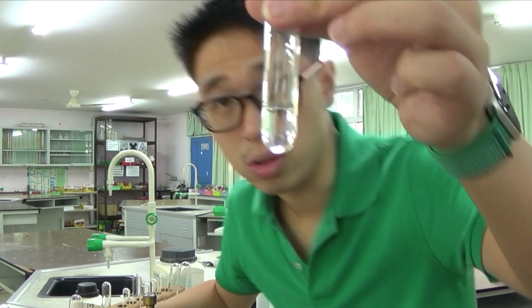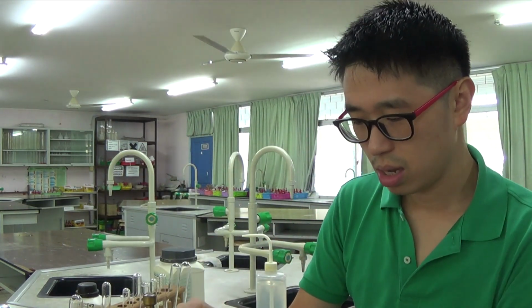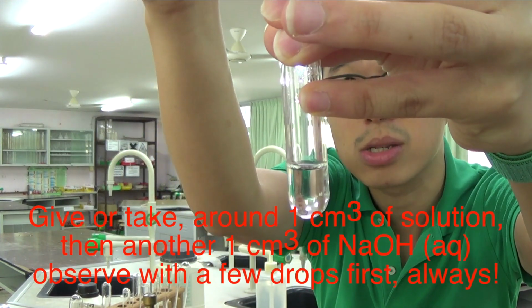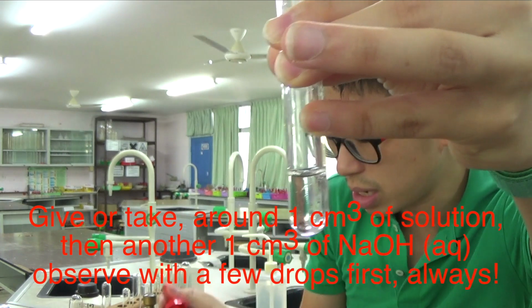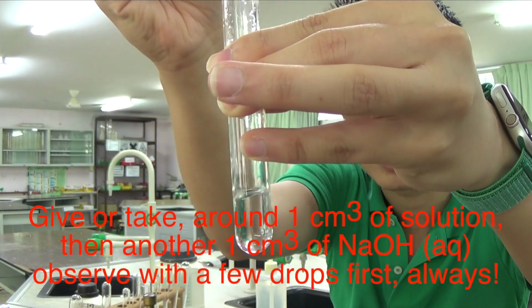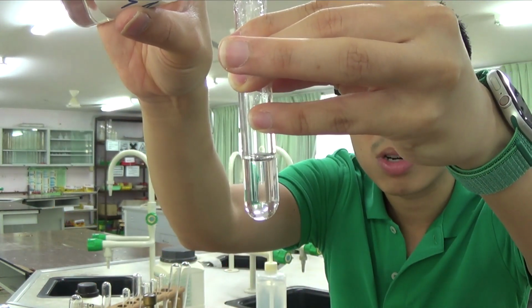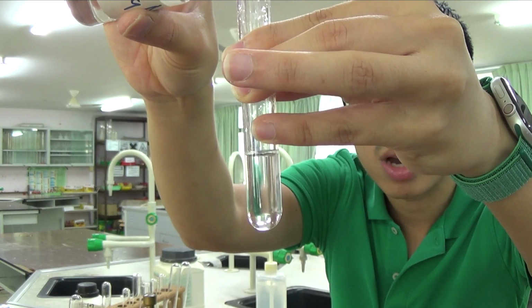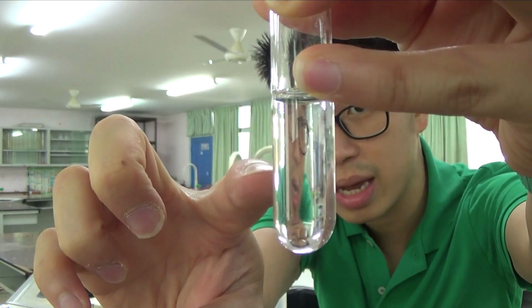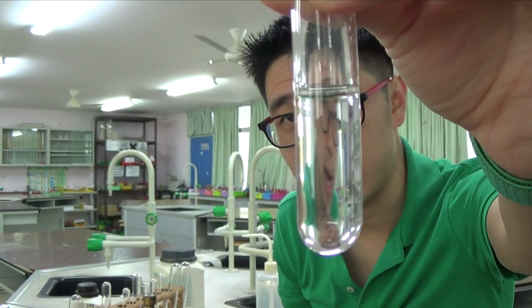So this was the solution, ammonium carbonate. So I'm testing for the cations. So when I have that much solution, I should add that much sodium hydroxide. So it's usually an equal amount of sodium hydroxide. So far, there really isn't any changes. There is no precipitate, nothing. You should add it drop by drop, but I'm already seeing no changes. Just now the solution was there, so we add around the equal amount of solution. As you could see, it is still colorless.